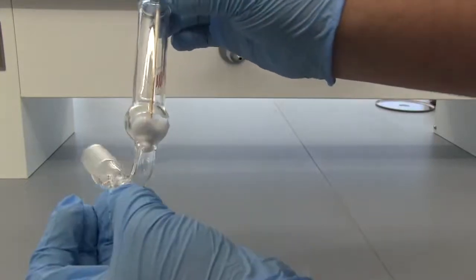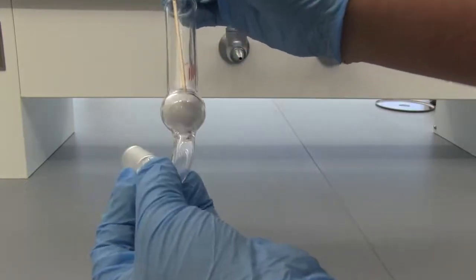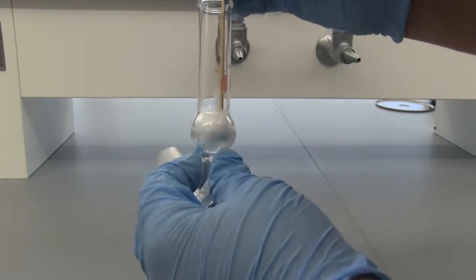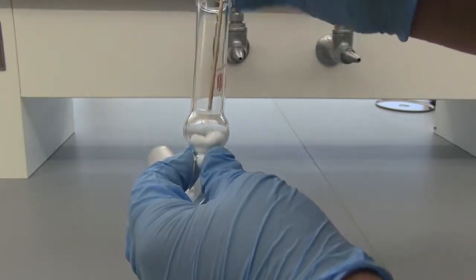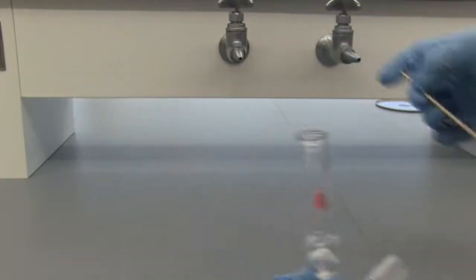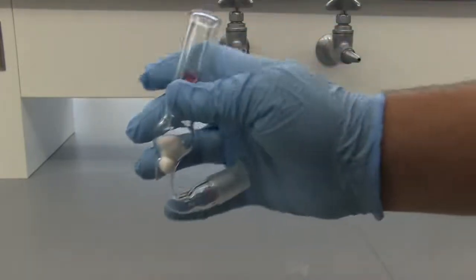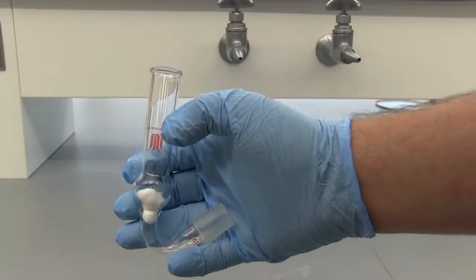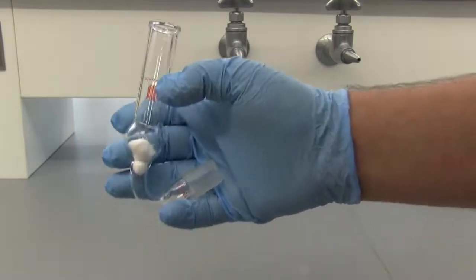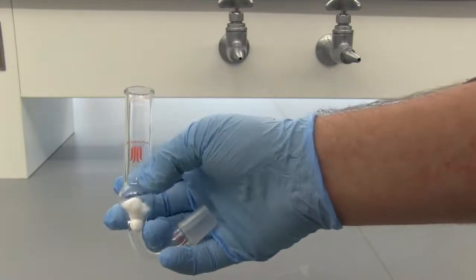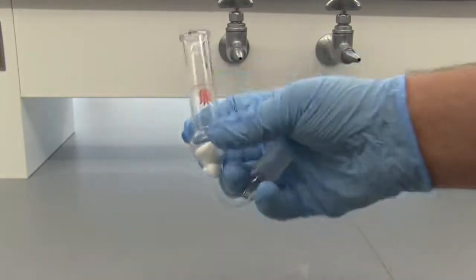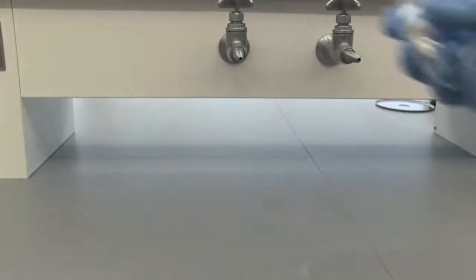And you just want it to—you don't want to push it so far down that it gets stuck in here, but you want it to settle at the bottom. And we put the calcium chloride in. That will help weigh it down as well. But there we go. Leave it there. Now we're going to load in some calcium chloride, probably about—fill it to about here or so. If you have the granulated calcium chloride, that may work a little better. We just have the powder right now. But you want to kind of loosely pack it so it's not—so it still lets some air through, but just not the moisture.